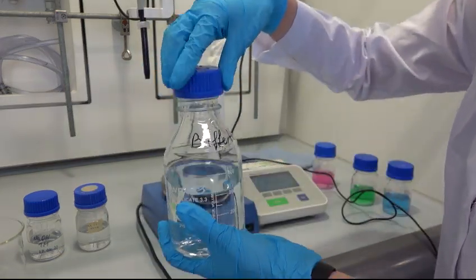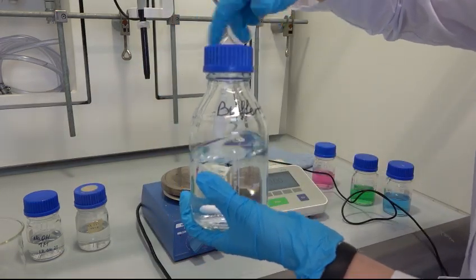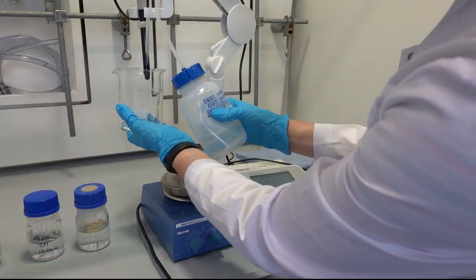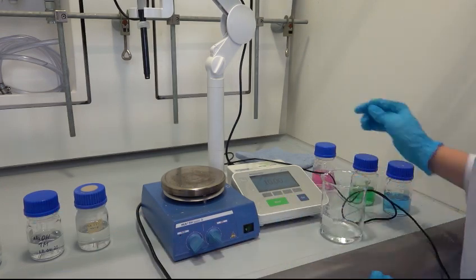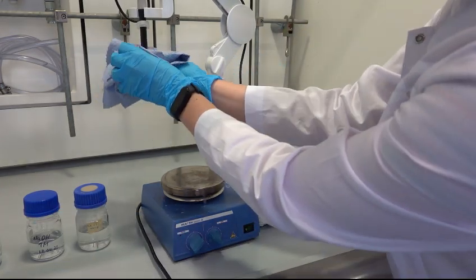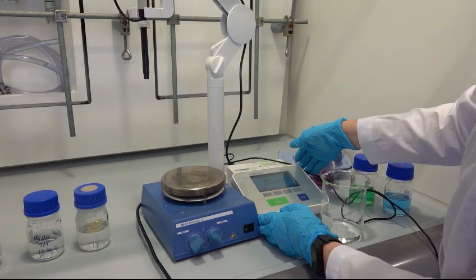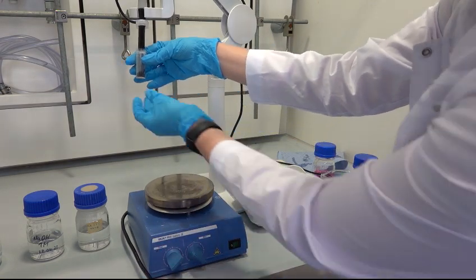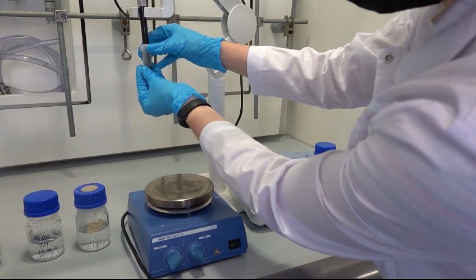When we successfully reach our desired level, we can remove the sensor from the bottle, rinse it with deionized water, and clean it with a tissue.